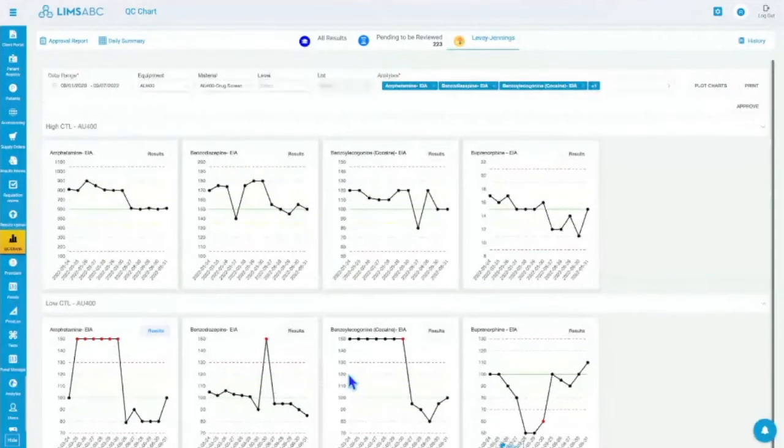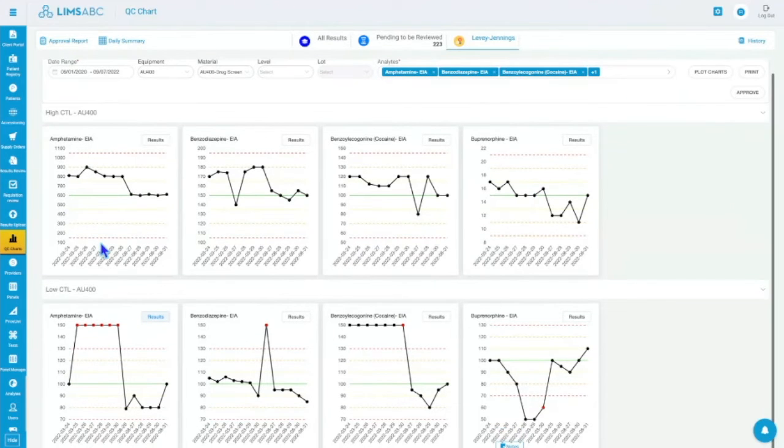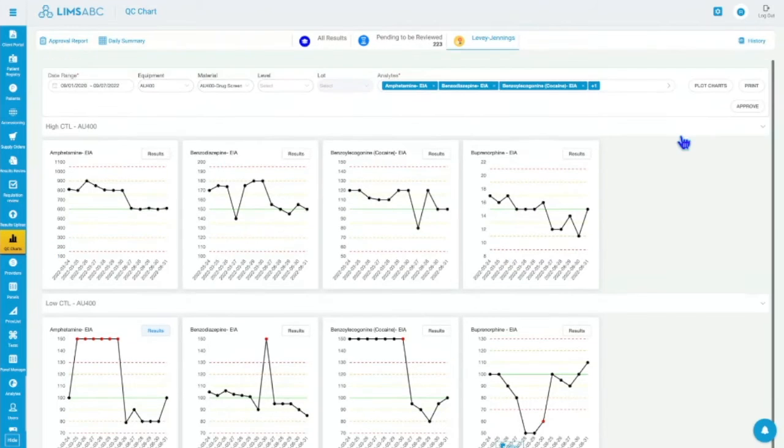If you have 100 targets, you'll see 100 targets here, and you can see we can fit about 5 of these on this screen, which is a normal size screen. So if you have 100, you'll have 20 of these. You can just scroll and see them. Obviously, it's based on what I have selected, but usually you will select them all. So if everything looks fine, then you just approve like I did.